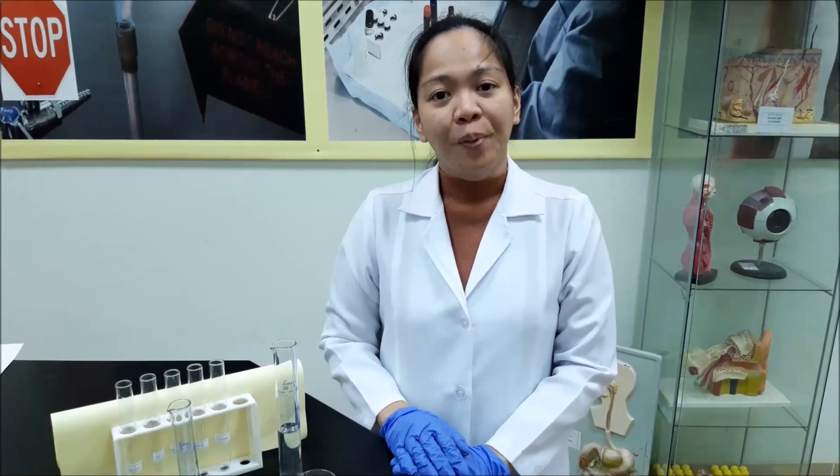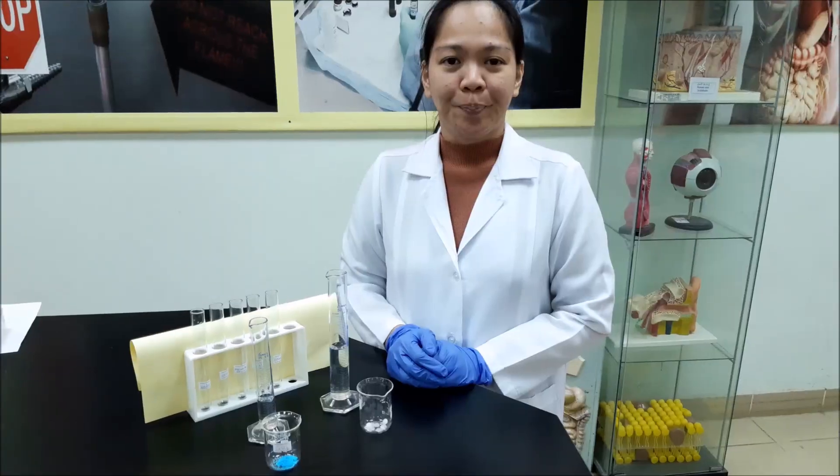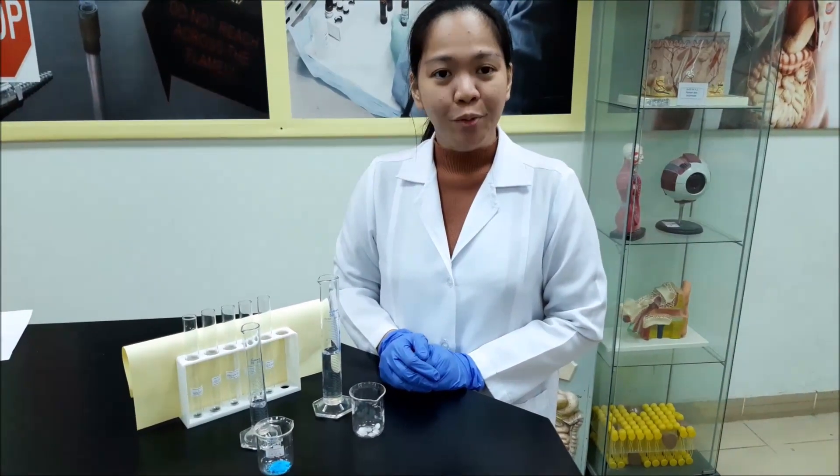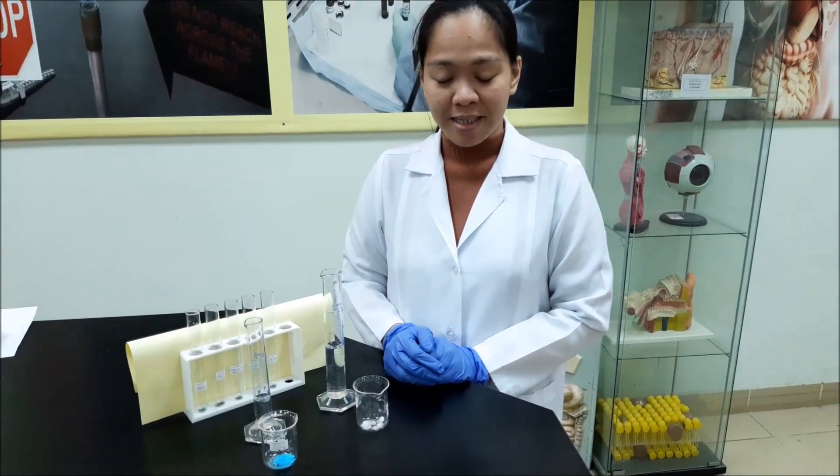In this experiment, we will do a food test. This is the presence of protein on food. Before we start the experiment, we have to prepare our solution for the test.